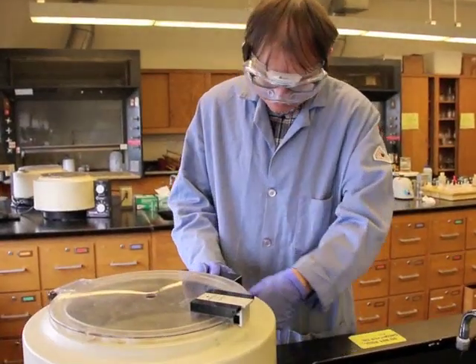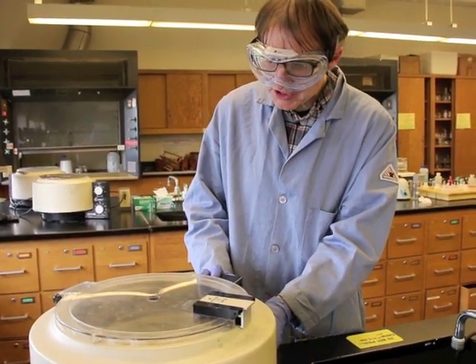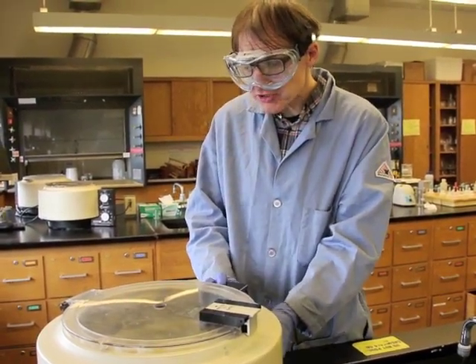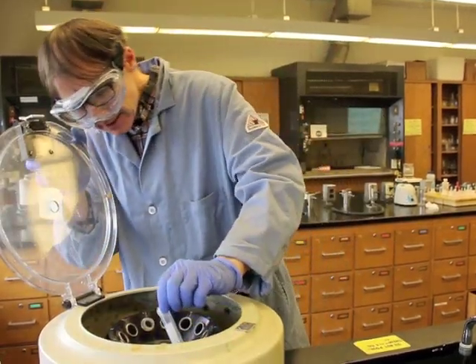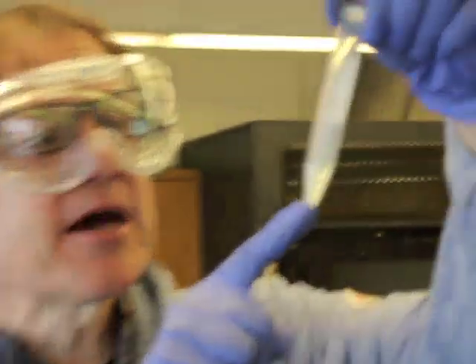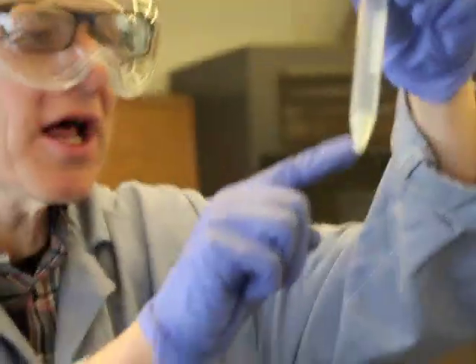Okay, so let's take a look and see whether we can detect the silver chloride precipitate down at the bottom of the test tube. This is the known now, so we would expect it to be there. All 4 ions are in the known. So let's open this up. And that's the water again. You'll notice I'm always picking up the water. Okay, so there we go. There's some solid down there at the bottom. That would be the silver chloride. But taking a look, there's a lot of it on the side.